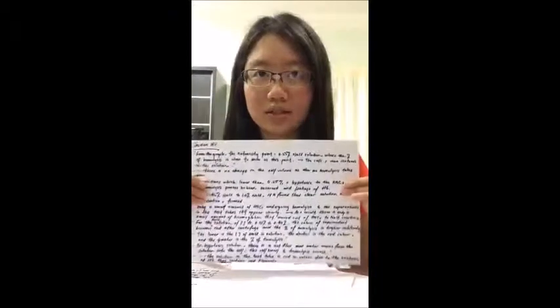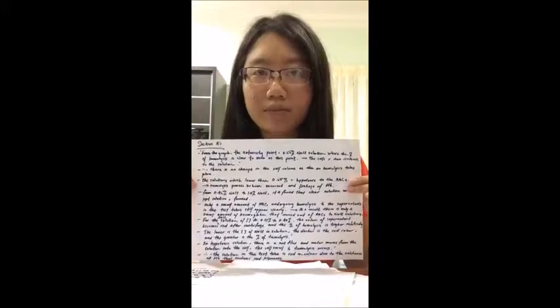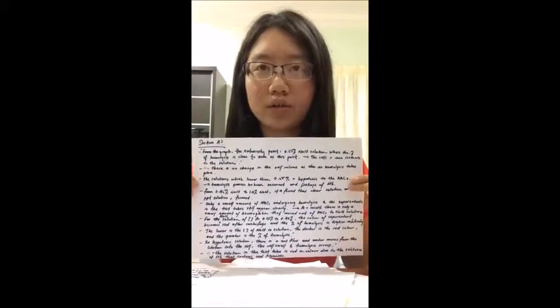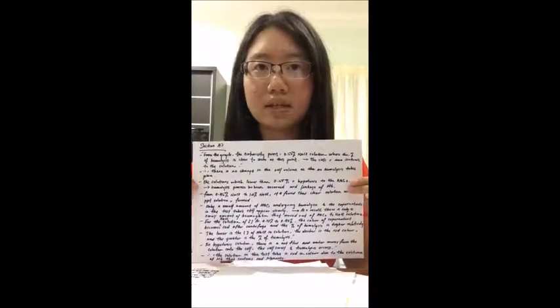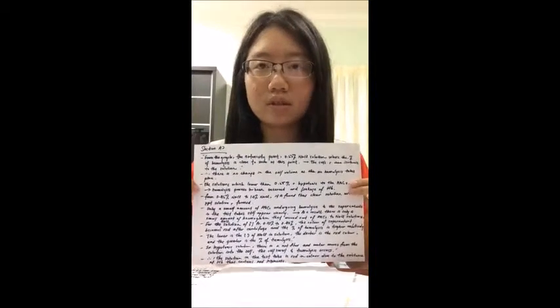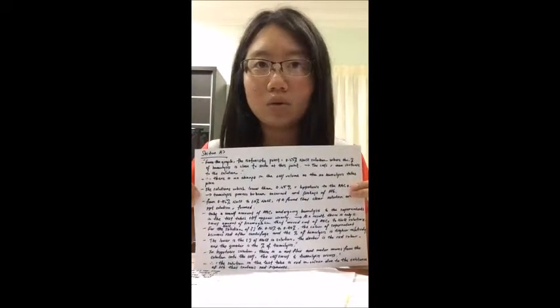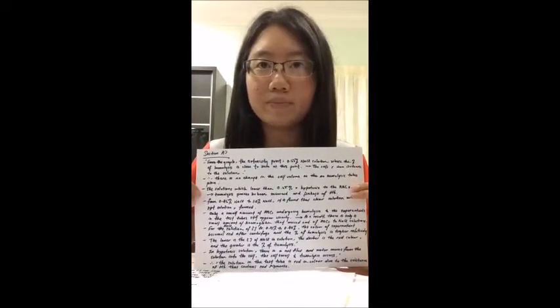Now we will discuss section A2. So these are the discussions about A2. The graph of percentage of hemolysis against sodium chloride concentrations shows that the percentage of hemolysis is inversely proportional to the concentrations of sodium chloride. The higher the concentration of sodium chloride, the lower the percentage of hemolysis of red blood cells.